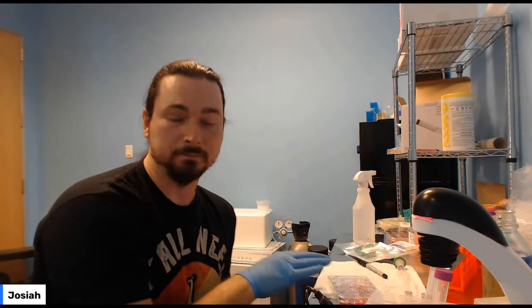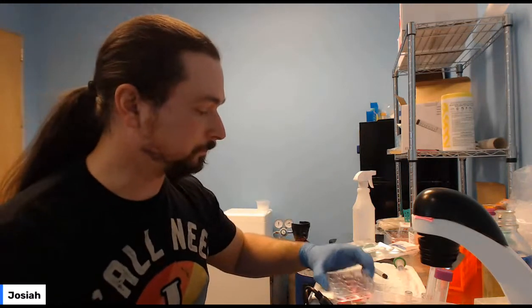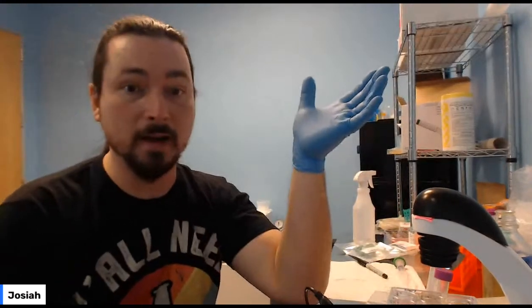Then you're going to wait 2 days. That 2 days is going to be time for the cells to recover. You'll probably notice that your cells look a little stressed. After the transformation, they're probably going to look a little more rounded and like they're not proliferating well because this is hard. So you'll change the media in all 4, both the ones with the DNA and the ones without the DNA. Just pull it out, put in fresh media, and then your cells will now have their new genes.